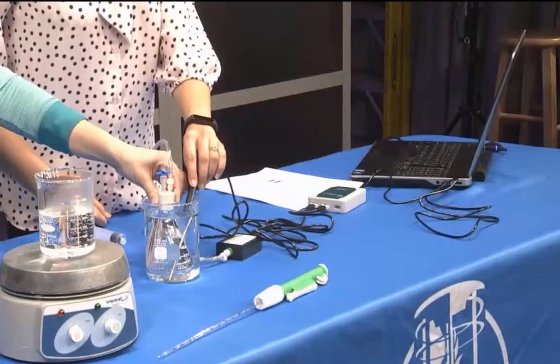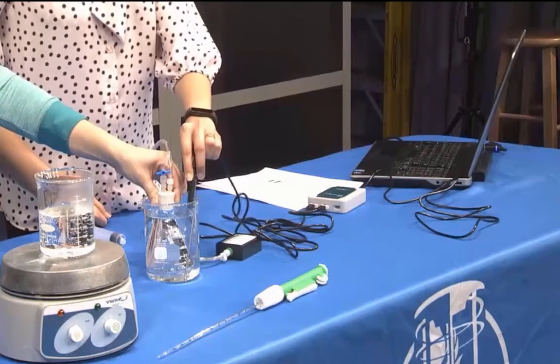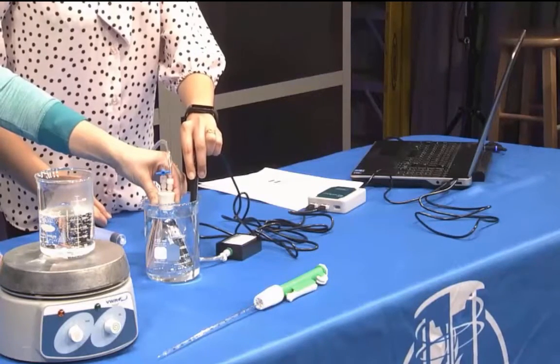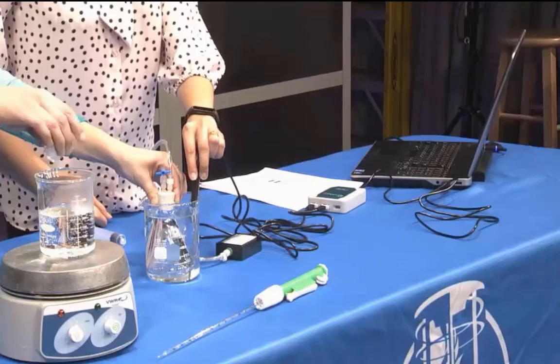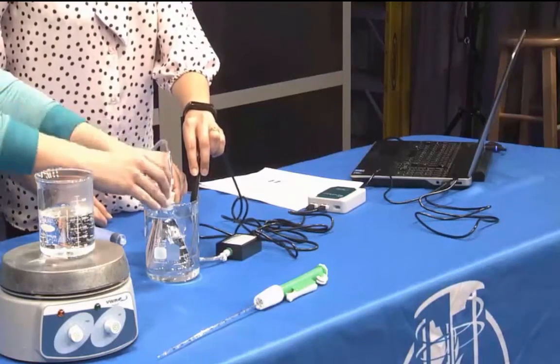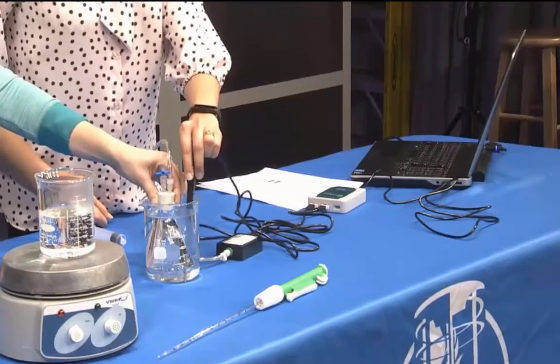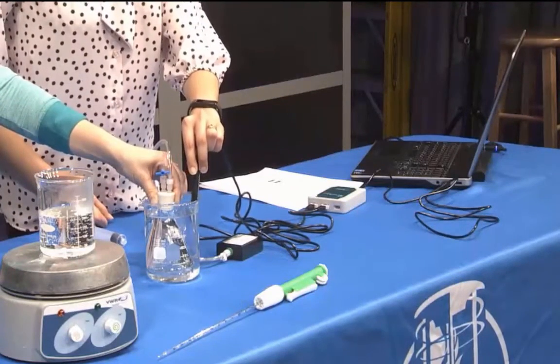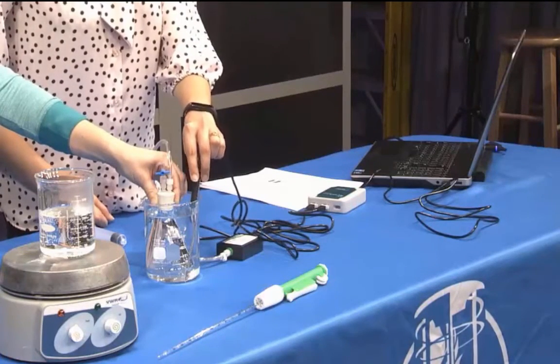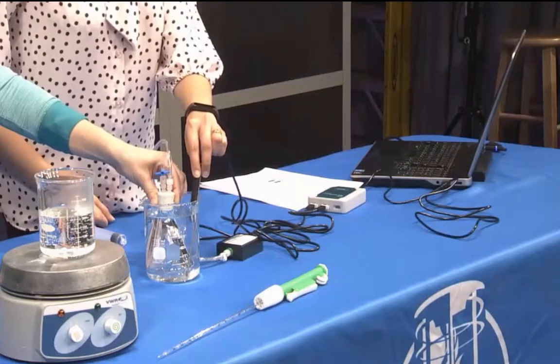Add a small amount of hot water from the beaker on the hot plate to warm the water bath by 3 to 5 degrees Celsius. Use a spoon or a small beaker to transfer the hot water. Stir the water bath slowly with the temperature probe. Monitor the pressure and temperature readings. When the readings stabilize, click Keep. You will observe a gradual change in vapor pressure.